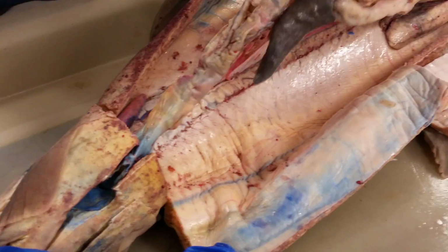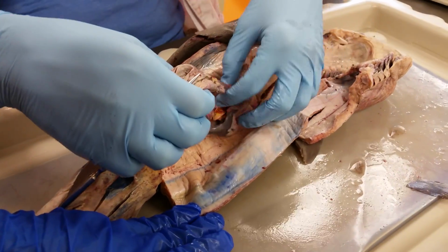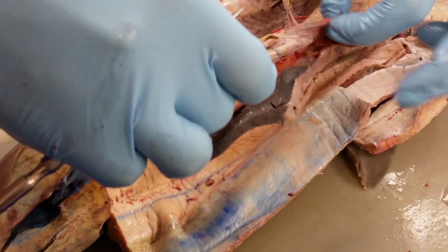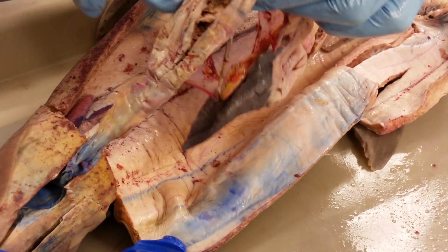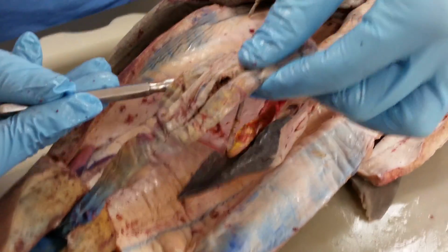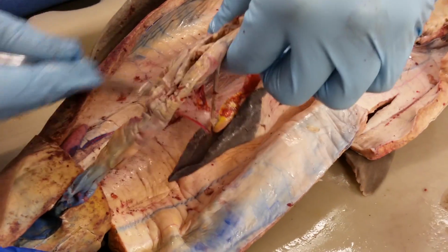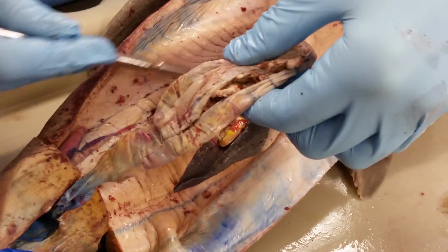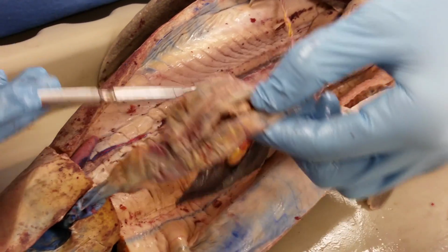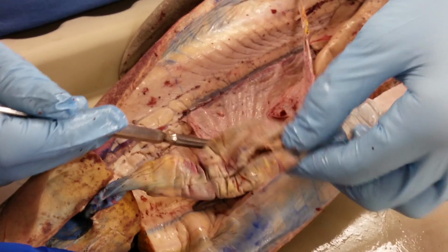valvular intestine, the spiral valve. Now this mesentery, this one's kind of ripped. The mesentery that suspends the valvular intestine, and then it goes over here, so this should all be filled in here. It connects to this mesogaster or greater omentum here. This mesentery here is just called the mesentery, right?